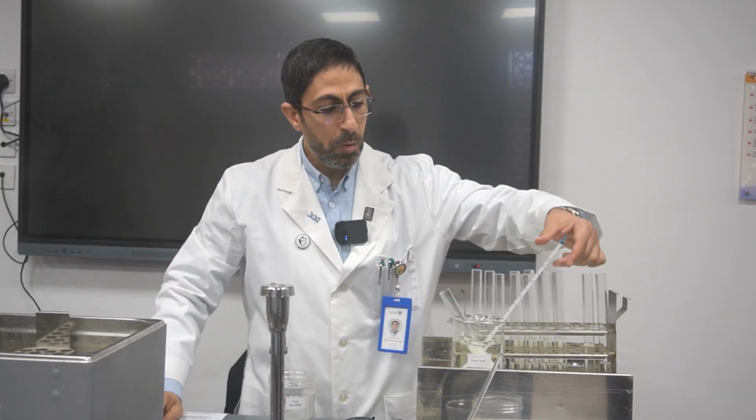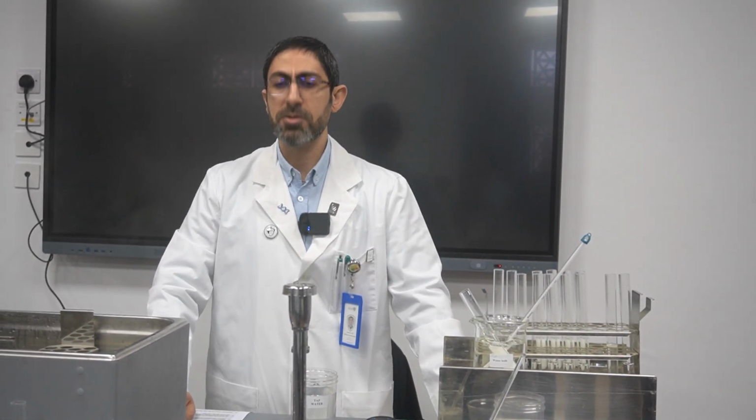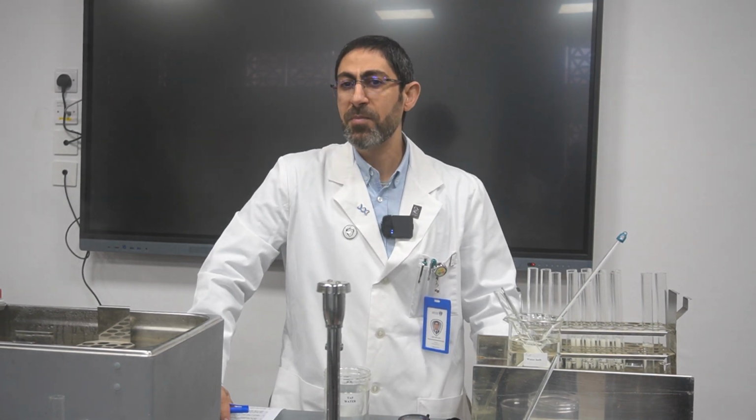What do you think that 20 will do? Will it be faster or slower? Slower, yeah, exactly. But there will be a reaction. Why will it be slower? Exactly, the temperature is lower, so the kinetic energy will be less.